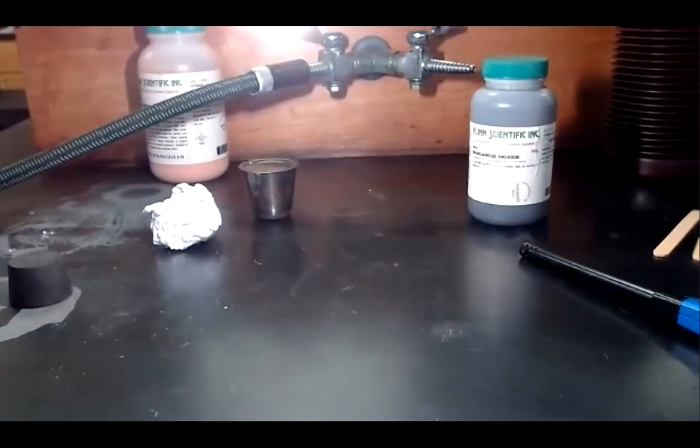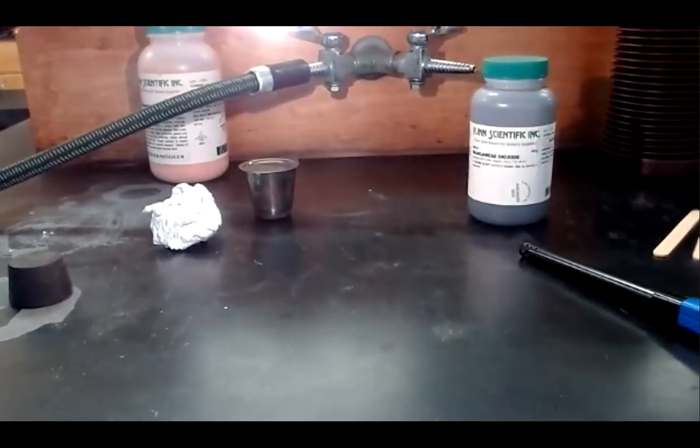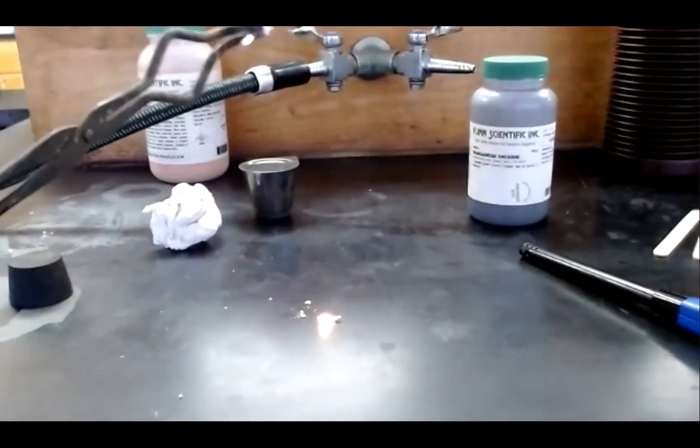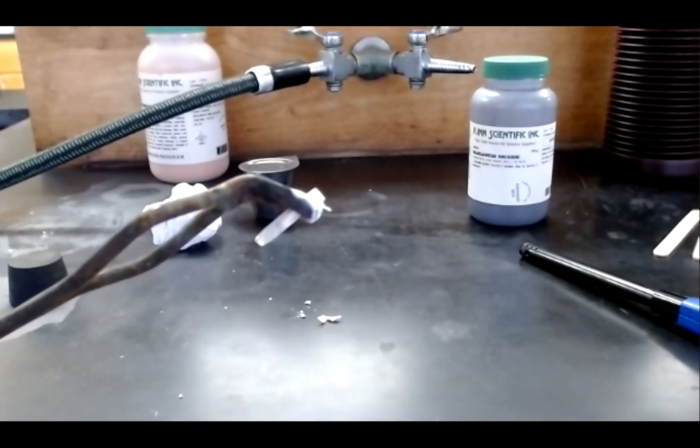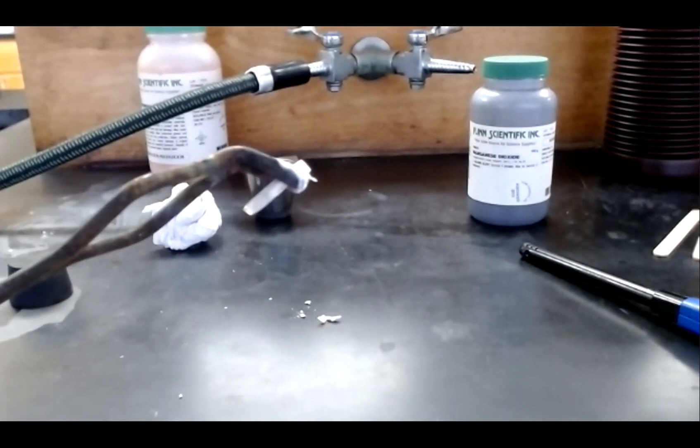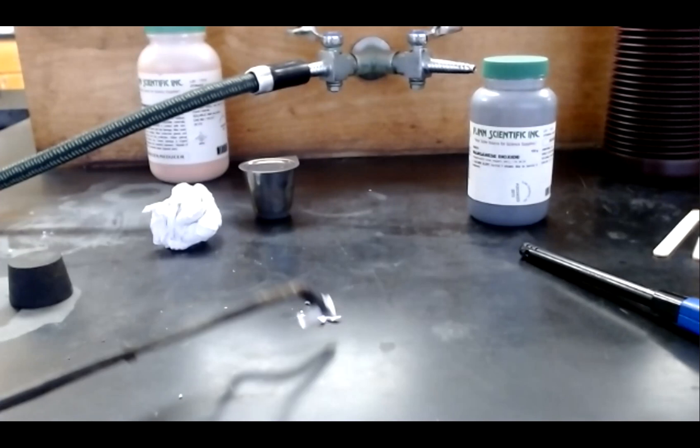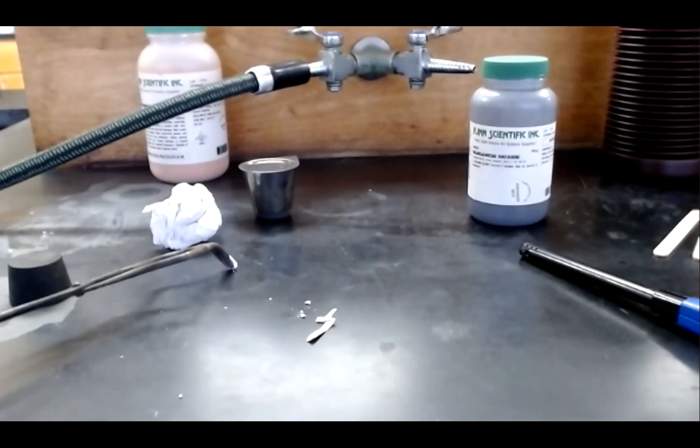You can see the tremendous amount of energy being released. And when this reaction finishes, you can see the solid magnesium oxide that has been formed. This white powdery substance.